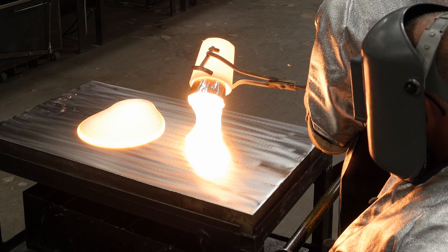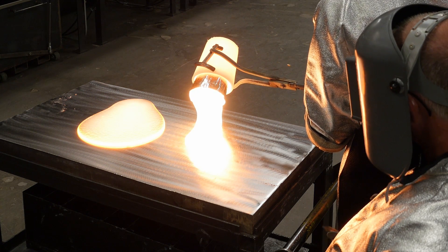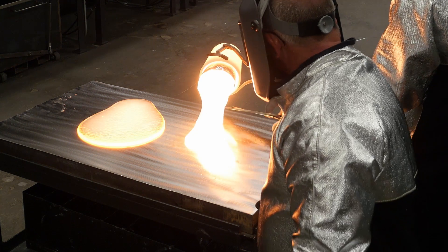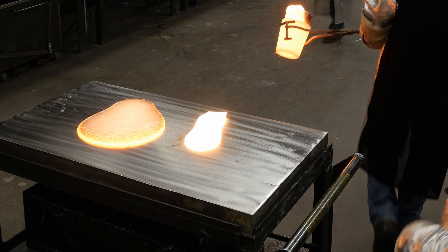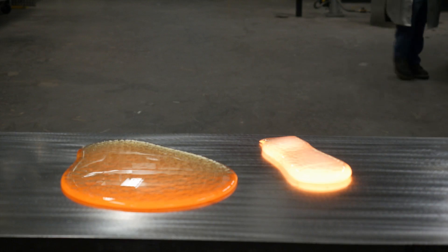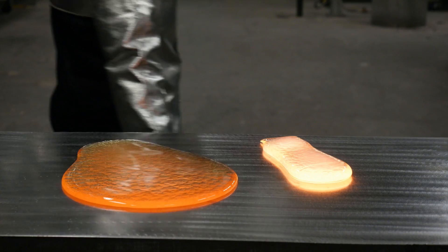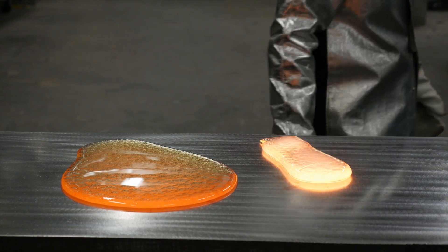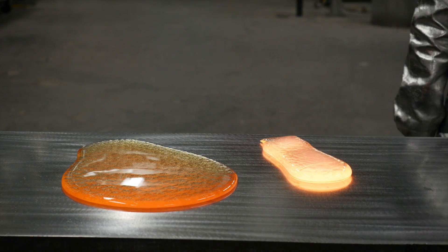This demonstration is a good visualization of how a high viscosity melt flows slowly, while a low viscosity melt flows quickly. The higher the viscosity of the melt, the less it will flow. You might be wondering, how can we decrease the viscosity of the specialty glass on the right so it will flow out of the crucible faster?